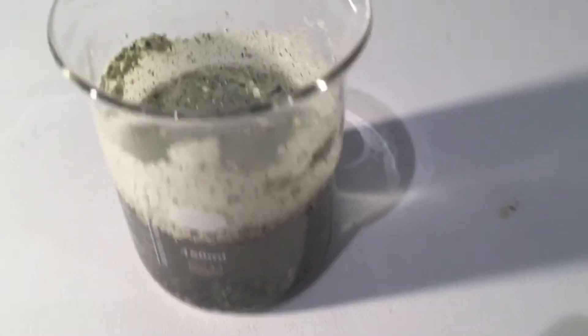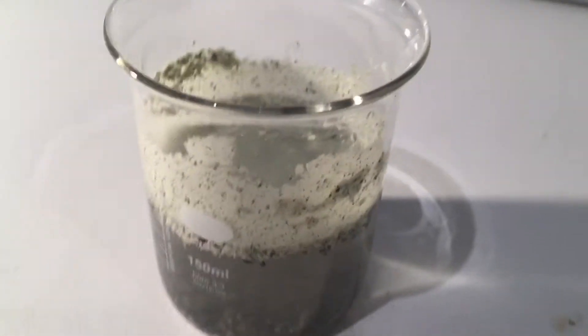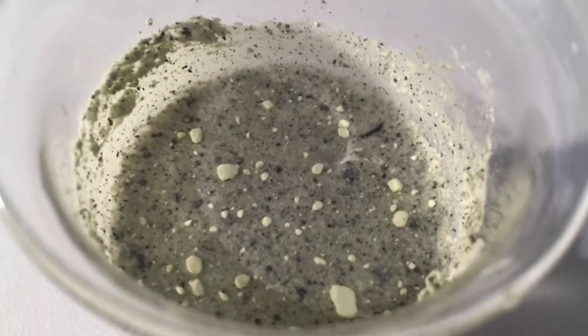With what I've currently produced, it forms about three main layers: the water layer containing the iron oxides and waste products that are soluble in water; a sulfur layer at the top; and a layer containing our product that is denser than the water at the bottom. I've done this because both things are insoluble in water, other than the impurities that were produced, and their different densities will allow the two layers to separate.